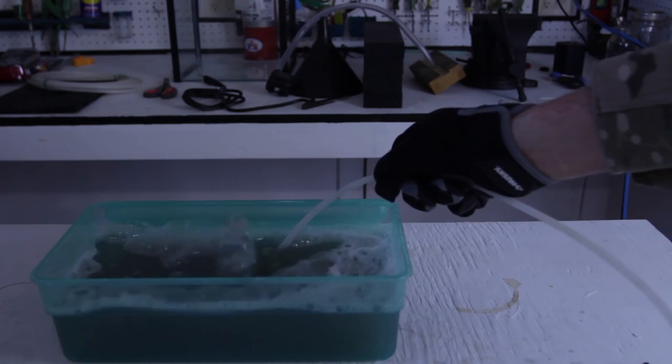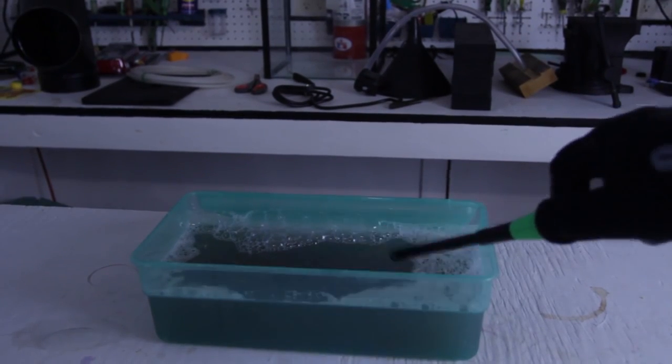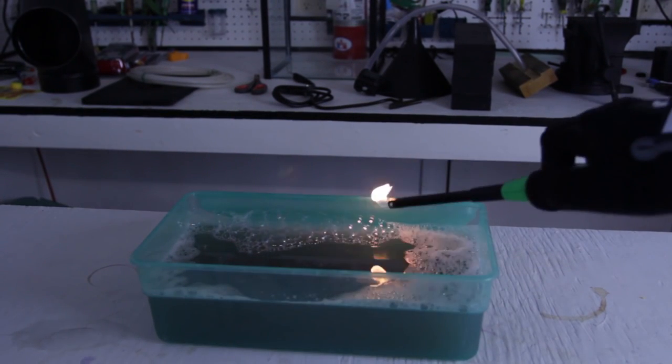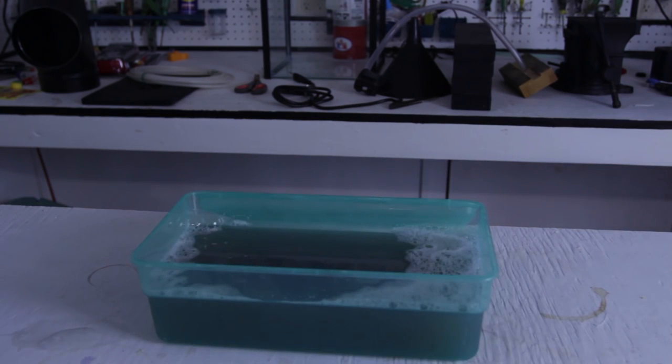Try it in the dark. Try this again. Boom. It's exploded. Boom. So awesome.